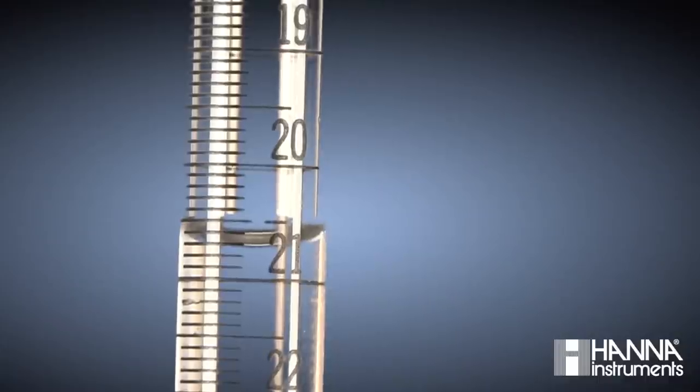Once we've reached our endpoint, we record our final titrant volume to be 21.28 mL. By determining the difference between our starting and final titrant volumes, we determined that 9.66 mL of titrant was used to reach the titration endpoint.